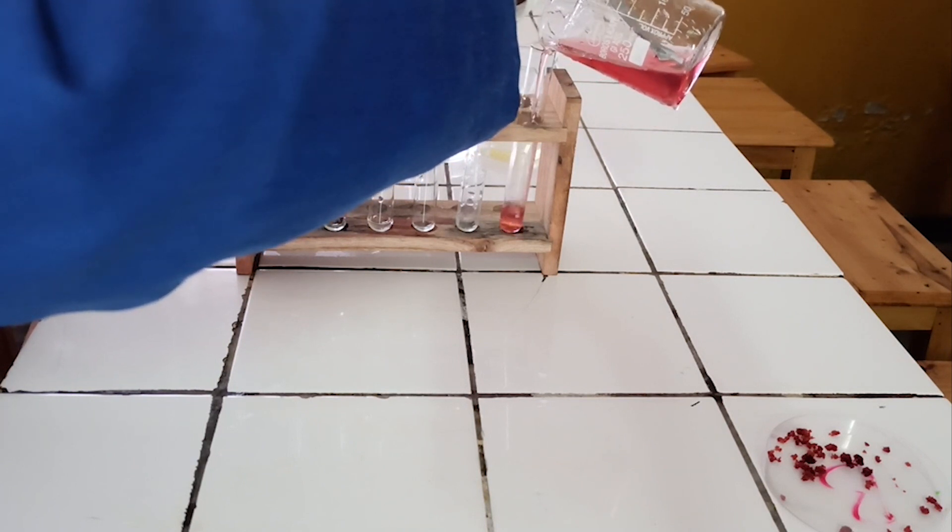Third step, divide the solution into test tubes, putting around 5 milliliters in each test tube.